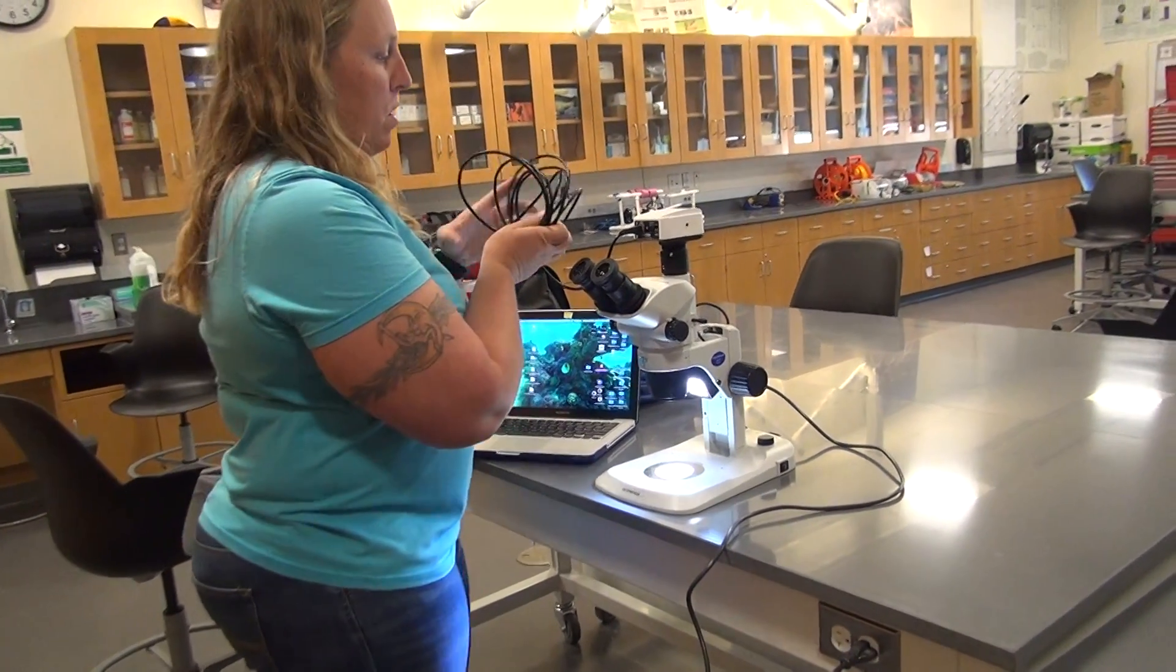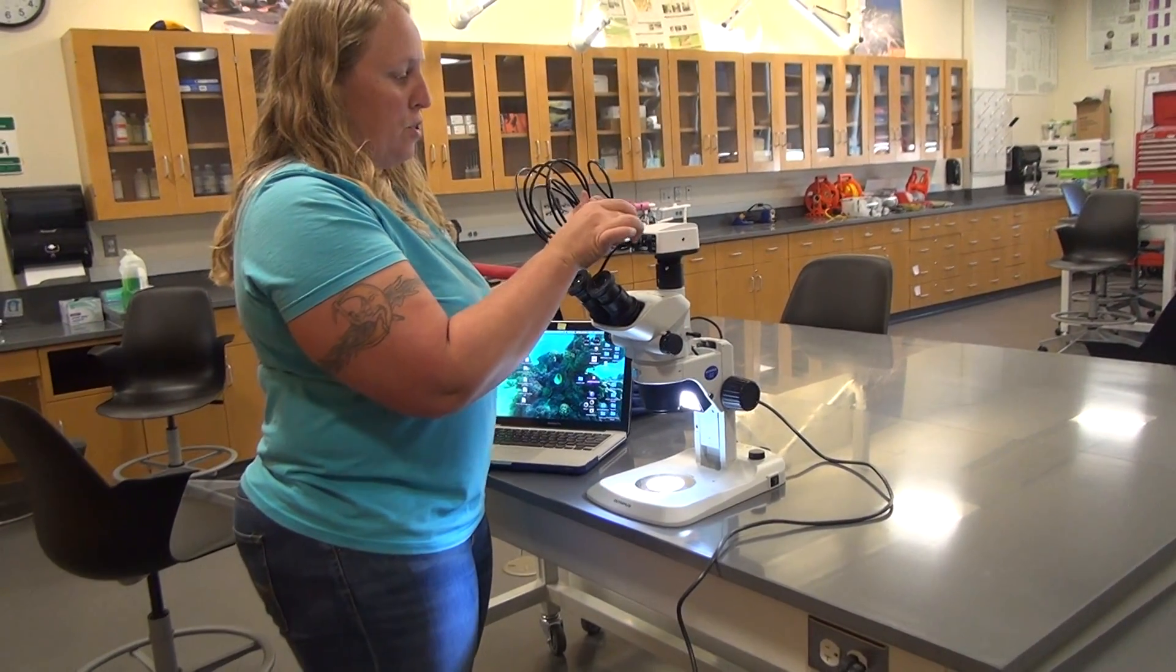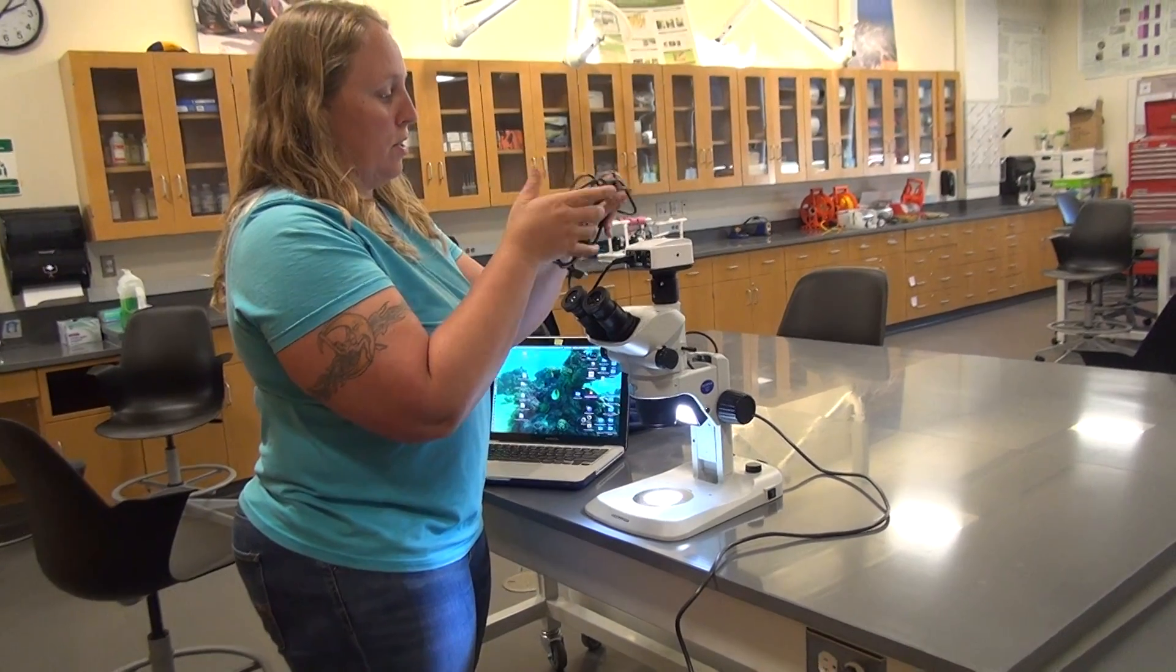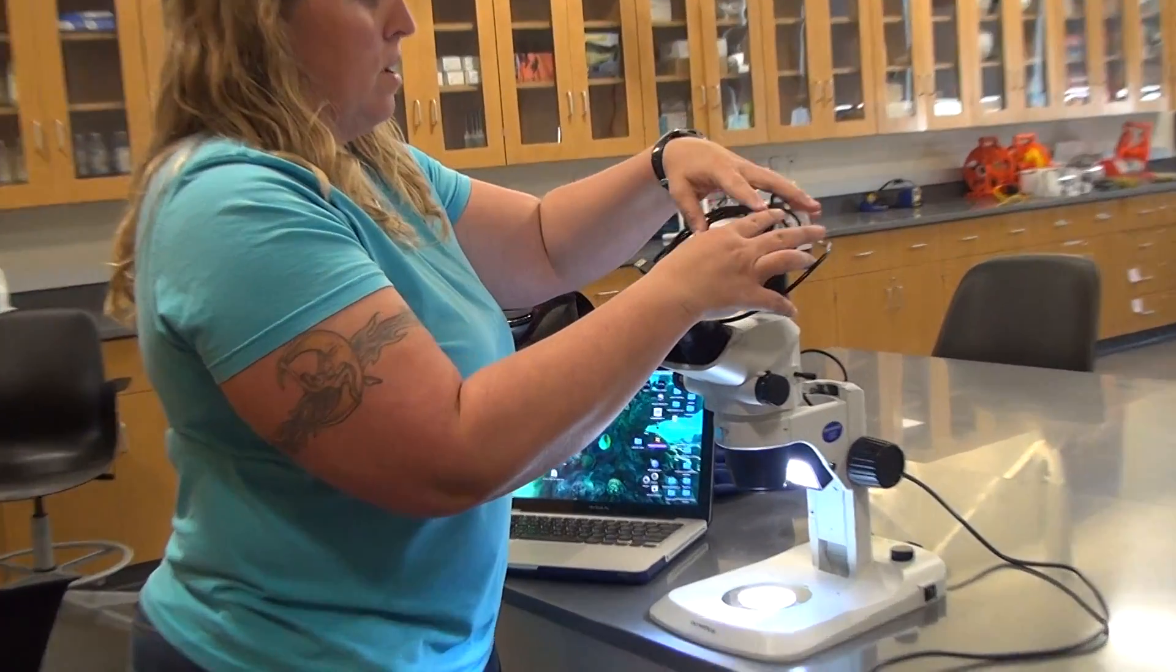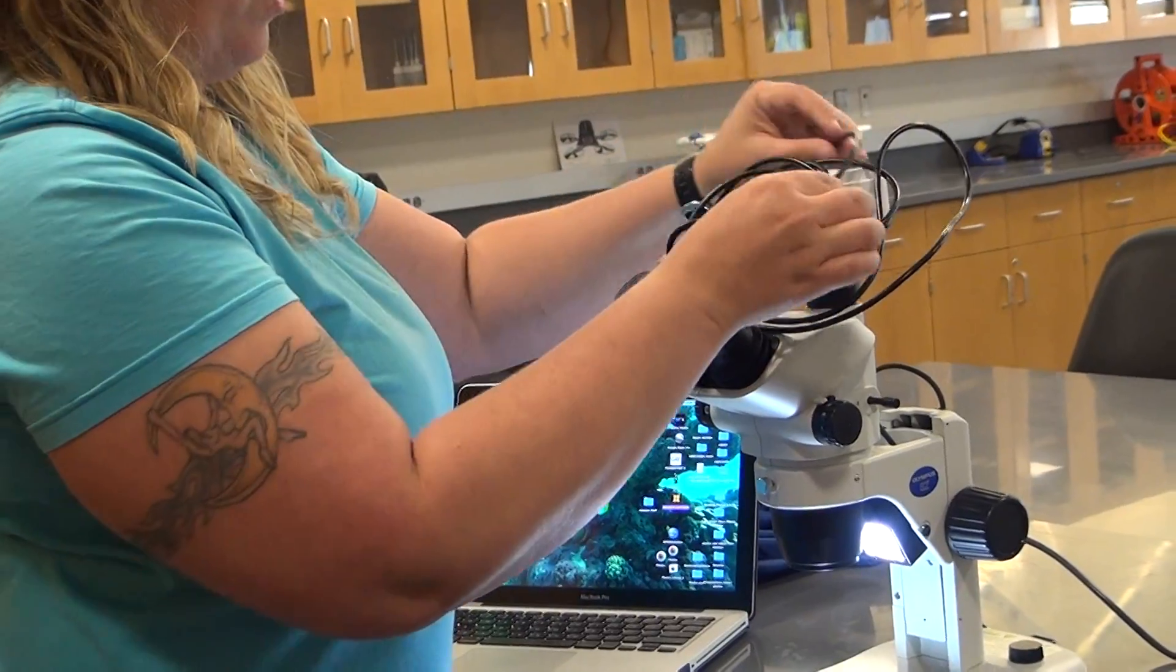And put it away. We stow the cord here. What you don't want to have happen is any stress on this part. Okay? It needs to be stress free. So nice and loose. It's okay if it's ugly. But loose is more important than a really pretty cord.